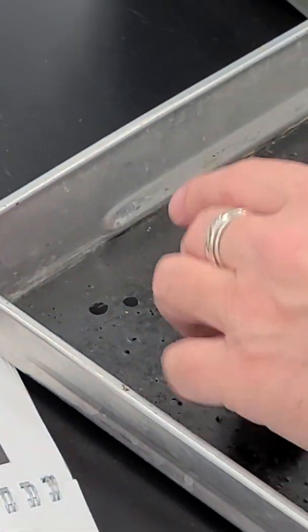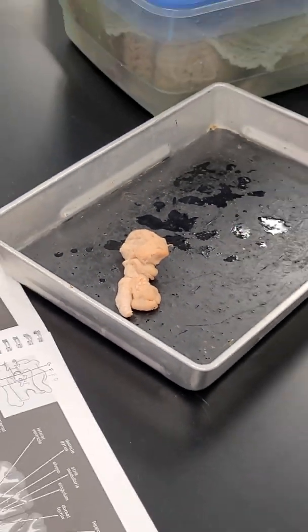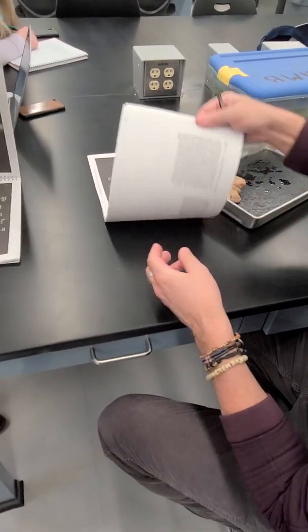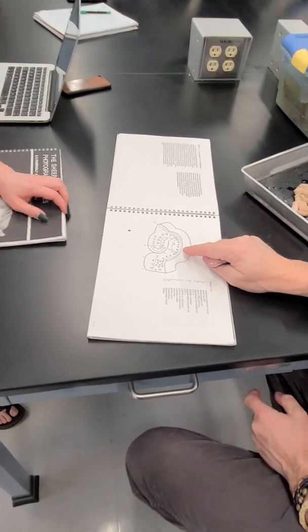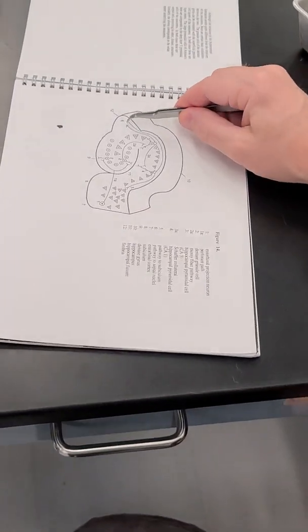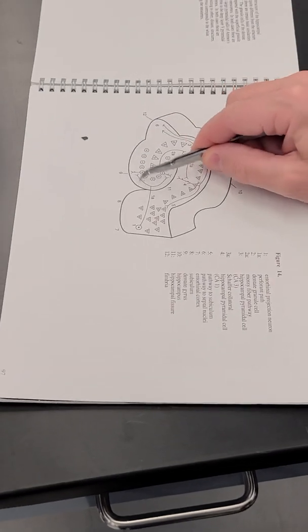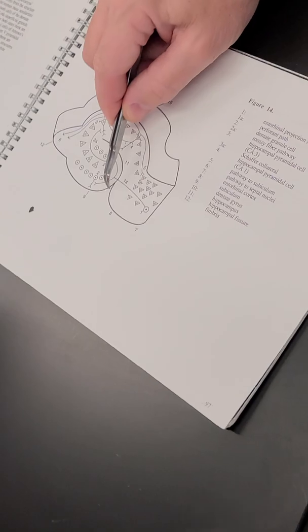So one of the things, and we'll see in the lecture text, you'll see the organization of these. Actually, I think they've got a drawing in the back here. If you cut the hippocampus in cross-section, here's the fimbria, the fibers at the cranial edge. Here is the dentate gyrus, and here's the hippocampal fissure.